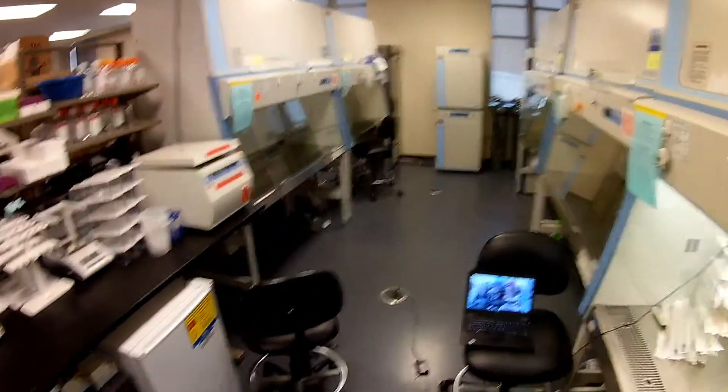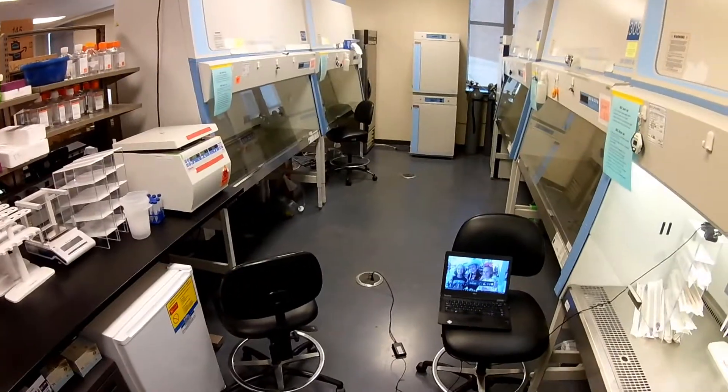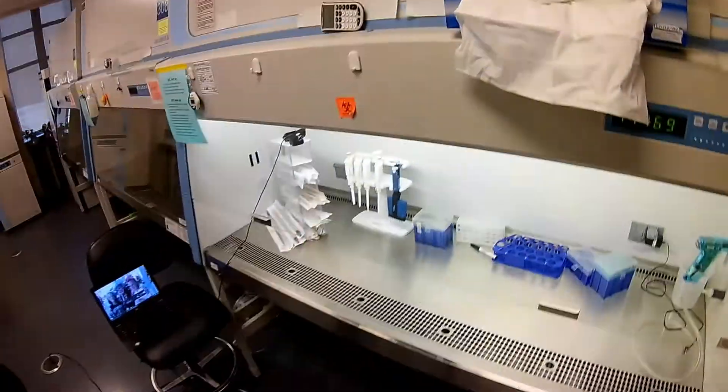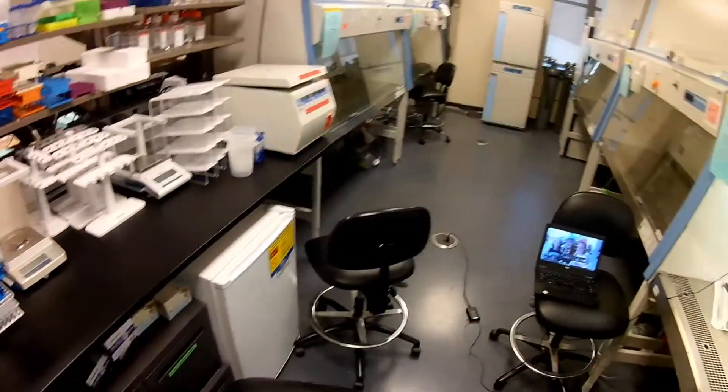Hi everybody, this is Dr. Dan. I am back today. This is two days since I have seeded cells, and so we are going to check if we need to feed them today or maybe even passage them today.